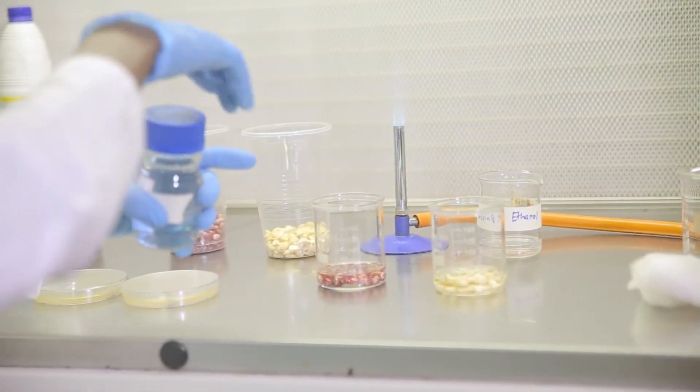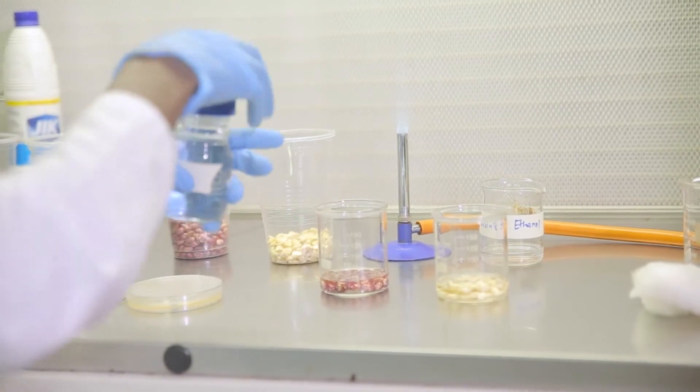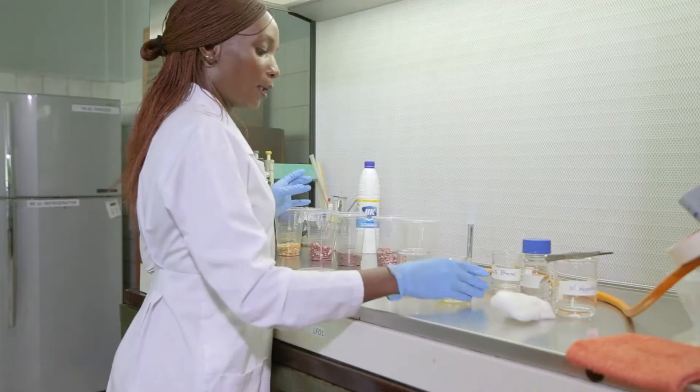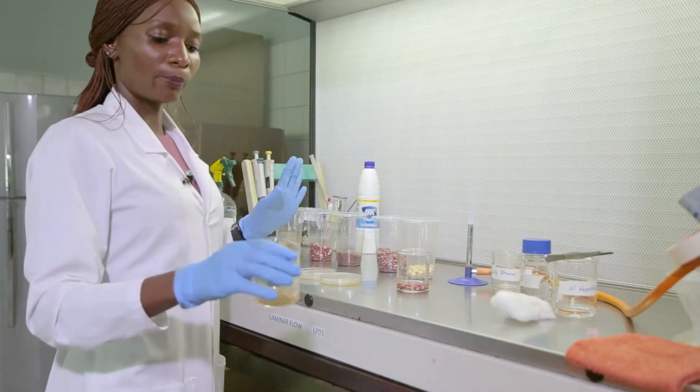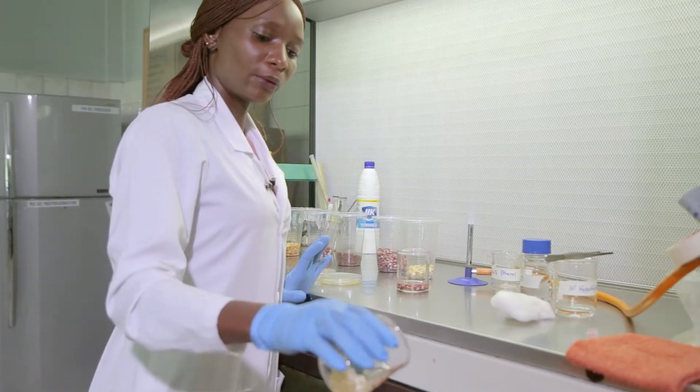So as we wait for the minute to elapse, I have my sterile water here. After a minute I am going to pour off the hypochlorite.